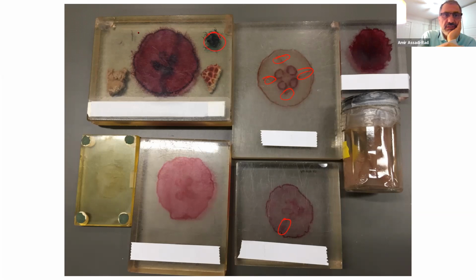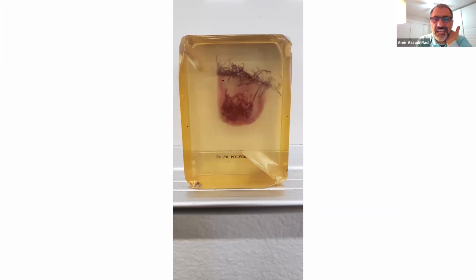Again, Gonionemus, Hydra, I'm sorry, Obelia, Hydra, Metridium. These are your class Anthozoa, the class, you know what I'm talking about. So anyhow, it will come to me and I'll come back to that. I promise you I'll come back to that one. Okay, right here, this is class Hydrozoa. I didn't talk about it in lecture, so do not worry about this one.